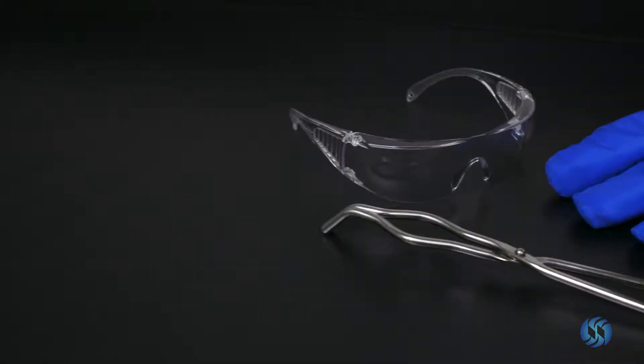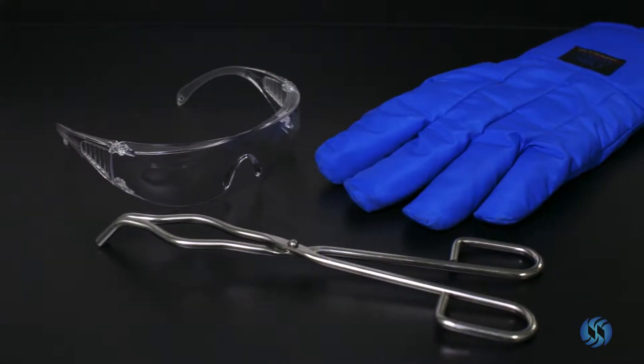Prior to cryo milling, please adhere to proper safety procedures. Wear safety glasses and avoid contact with liquid nitrogen.